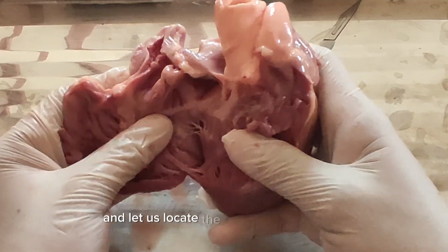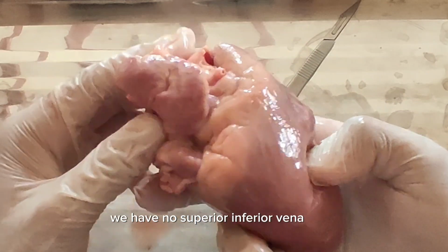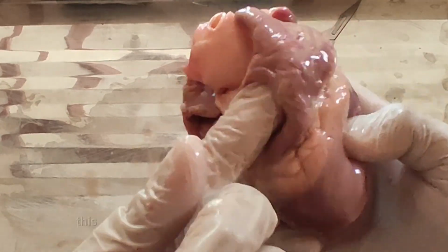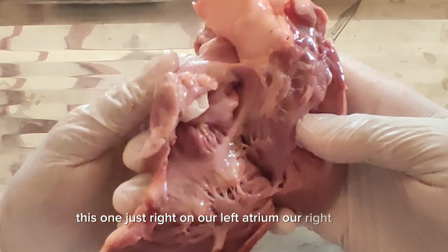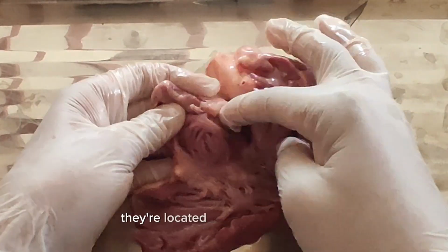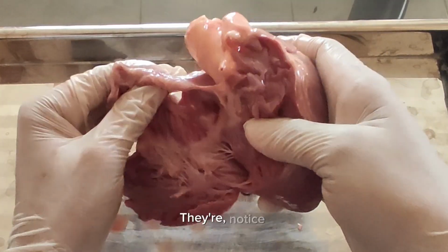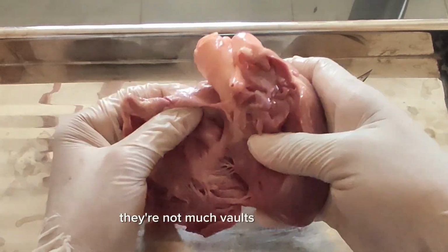And let us locate the inferior and superior vena cava. Again, we have no superior and inferior vena cava still intact here, but we have the vena cava that is here. Use your probe to locate it. This one is just right on our right atrium. This is our vena cava. They're located within our right atrium, in which this chamber is lacking valves. Actually, there are not many valves around here.